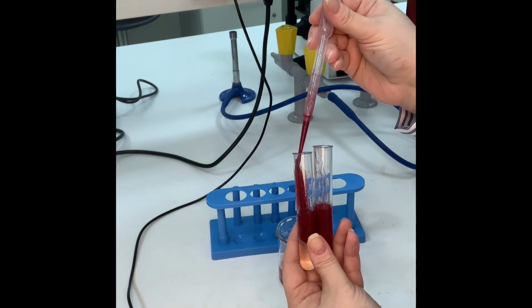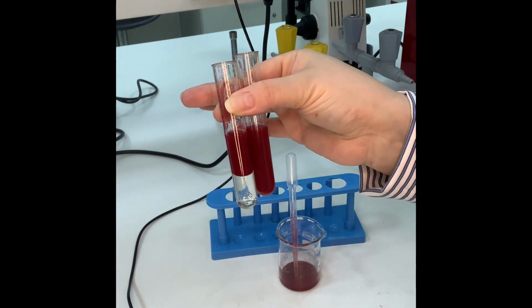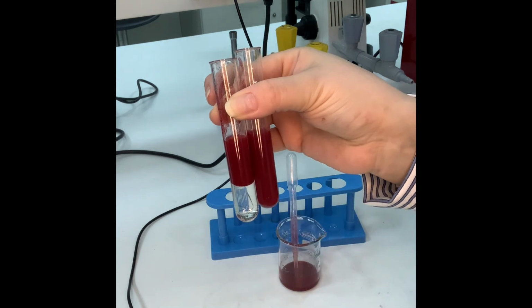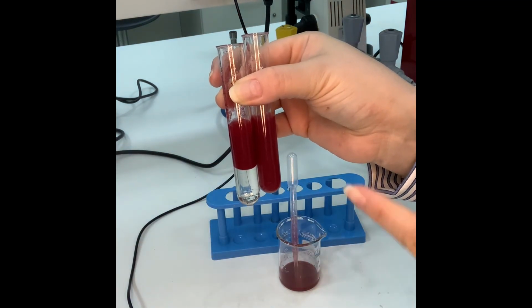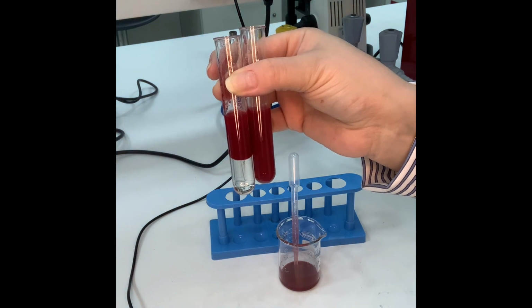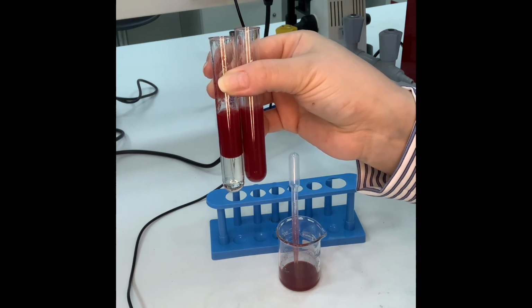While look at the oil, it is isolated away from the alcohol. It's always on the top. Okay, it isolates it on the top. So this is how we know that there is oil in this mixture. We add Sudan Red, it captures or isolates all lipid layers on the top and keeps the liquid or solute in the bottom. Simple? Yes.